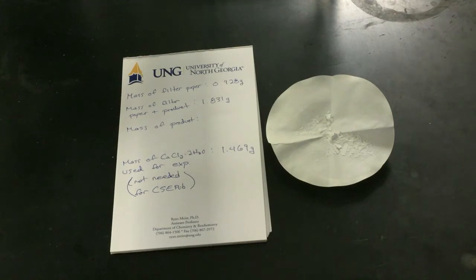We don't need any special waste disposal for this particular experiment, which is one nice thing about doing it this way. All of our components are not really toxic to the environment. We do want to watch calcium concentrations in normal tap water and control them if we can, but we don't have enough here to worry too much about leftover calcium in the solutions. So most of that we can put down the sink. This waste can go in the trash. So it's pretty easy cleanup for this particular experiment.